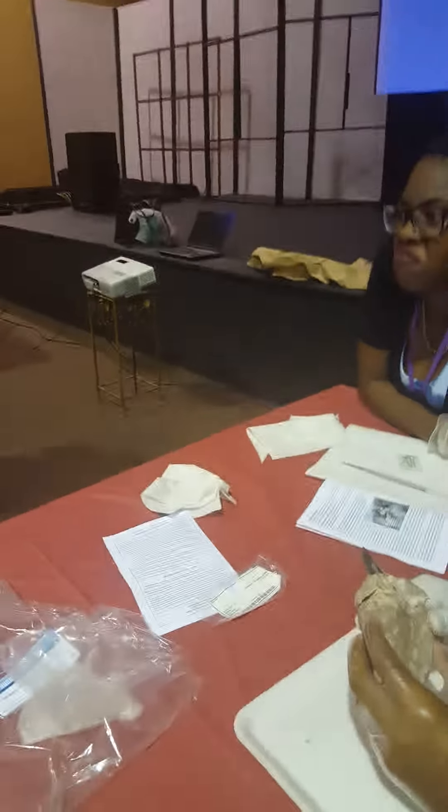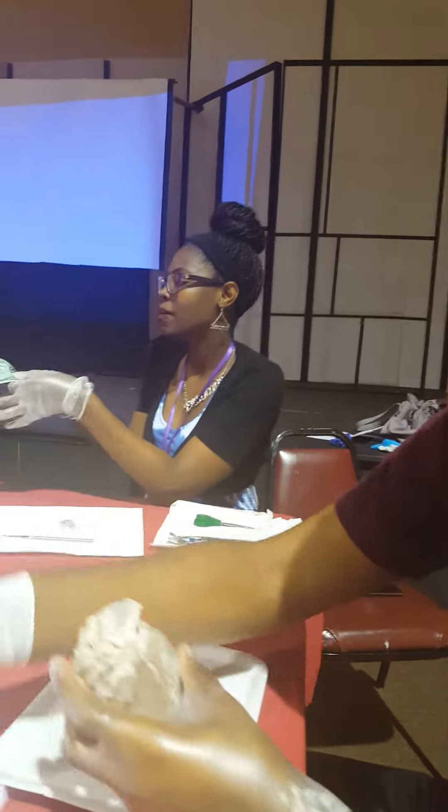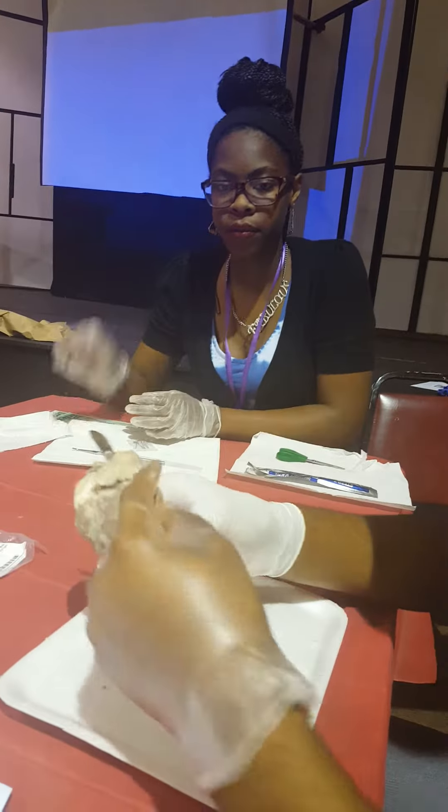From the heart — this is a sheep's heart. And then after that, as you can see on this paper, this is the front of the heart. No, just kidding. This is the front of the heart.